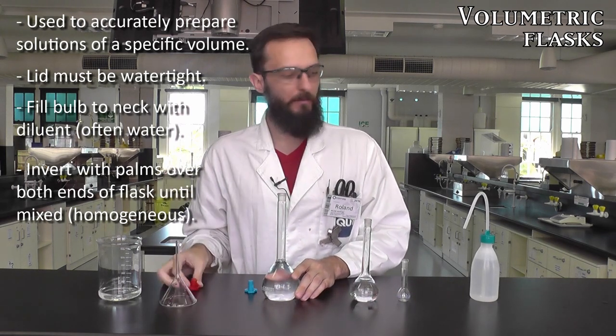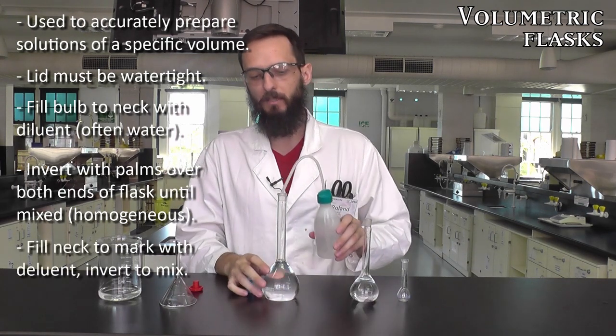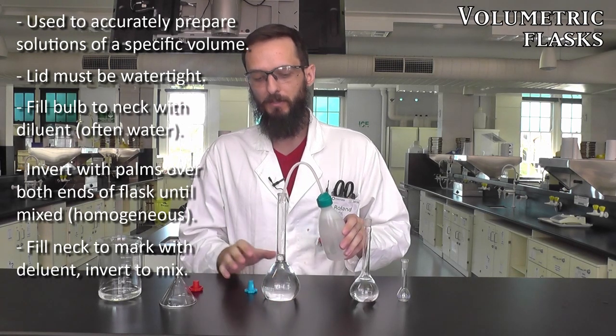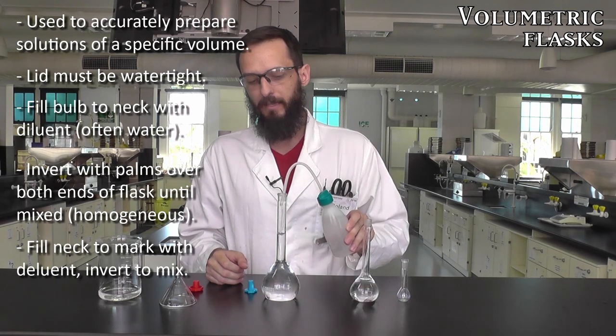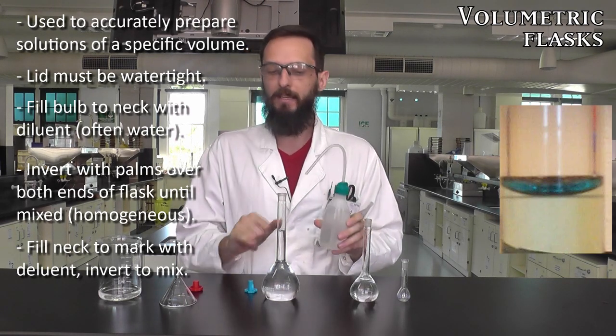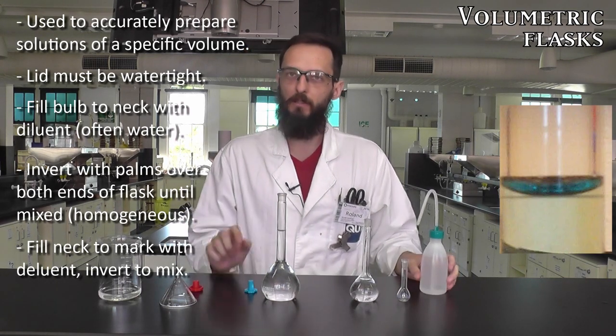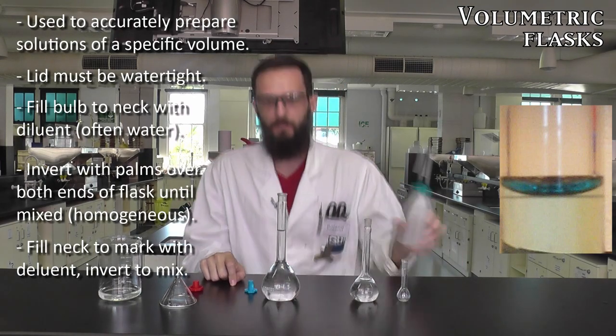Once we can see that our solids are adequately dissolved, we can fill the remainder using a squirt bottle filled with deionized water. Always remember that anything that goes into your reaction must be deionized water to prevent any impurities. I know I'm at the top because there's a mark in the neck and I want to make sure the meniscus of the liquid sits right on that mark, so just a tad more.